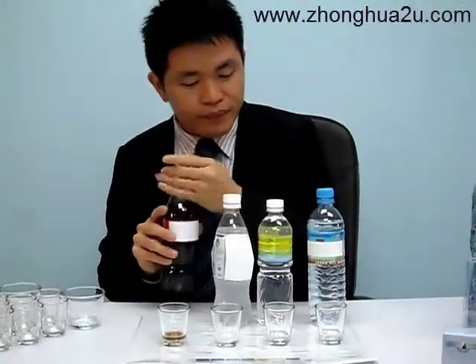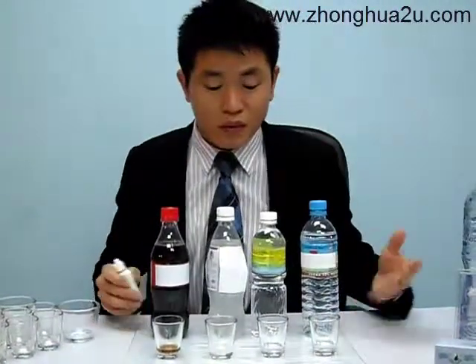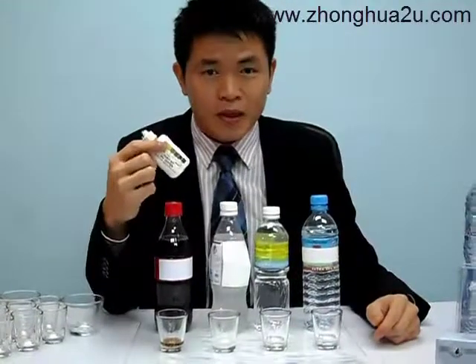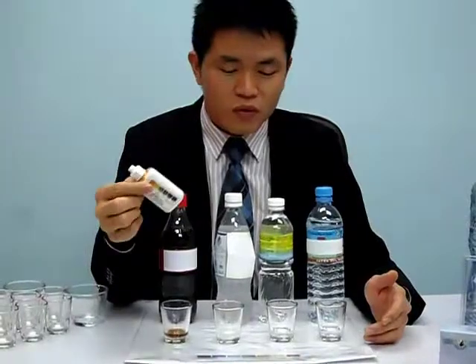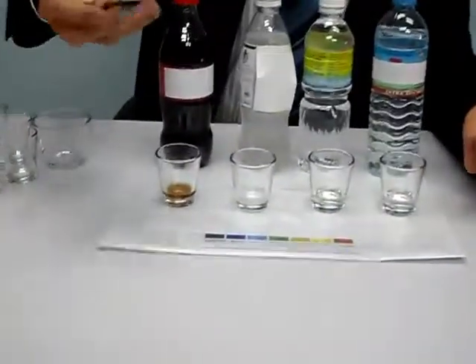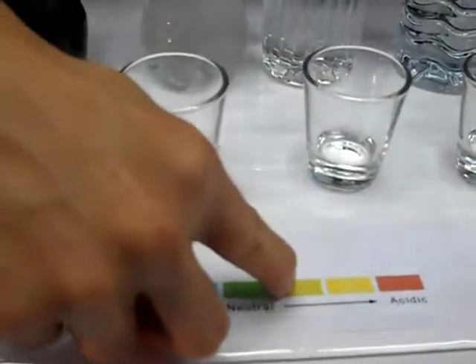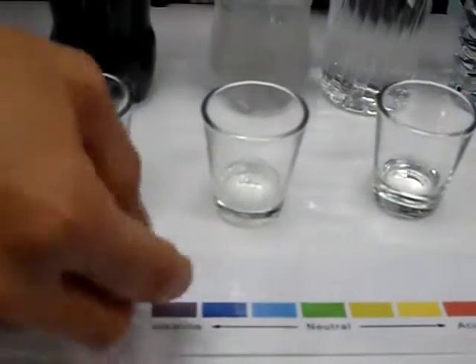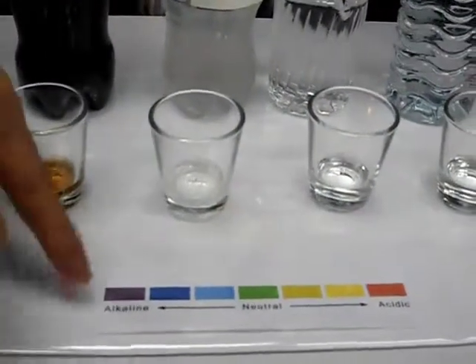Alright. So how am I going to show the pH of these liquids? I use the pH tester, the very common universal pH tester. The result is shown by a color chart. If it is green, which is neutral, you can see in the bar here. If it's yellow to orange, this means it's acidic. And from blue to purple, it is alkaline, with purple as the most alkaline, which is a pH of 14.